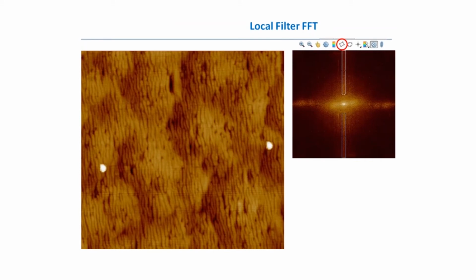Previously we used band filtration, and here is another example of how to use the local filter, because we can choose some specific frequencies and delete only them, not all frequencies which lie higher or lower than some threshold. From the left side you can see the image, which has very specific and very common artifacts. These artifacts come from bad vibration isolation of the system, and if you don't have active vibration isolation, and especially somebody is walking loudly in your lab, most likely you see these artifacts like horizontal lines in your images, especially in flat images.